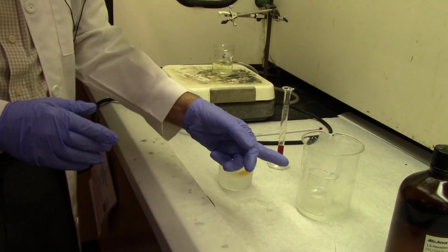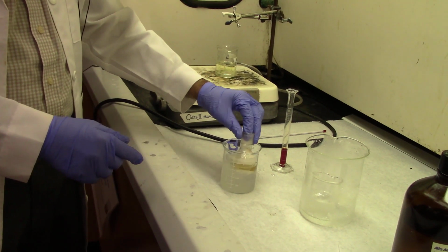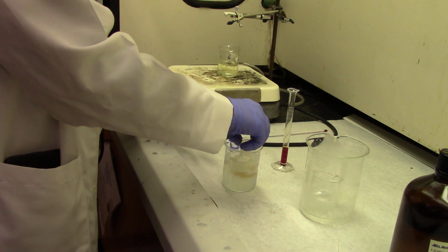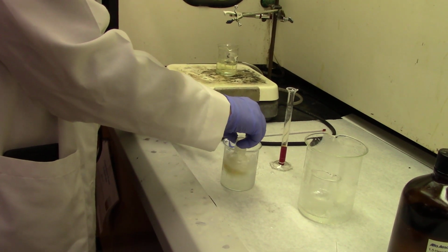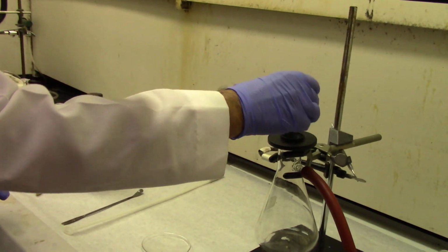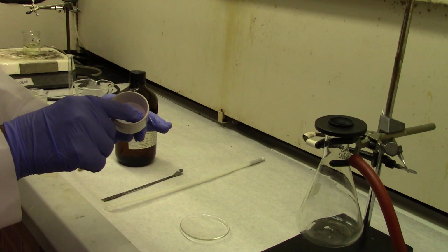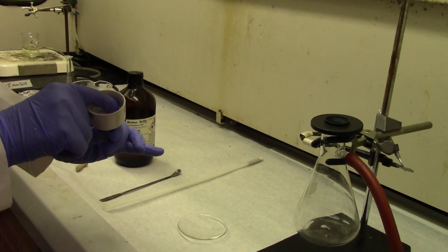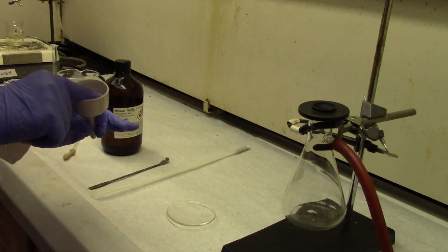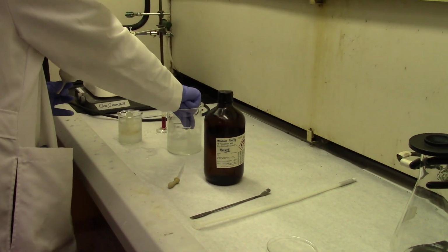The small beaker contains dichloromethane, and we are basically cooling that, because we need this solvent later on for washing our precipitate, or the product. The best way to cool it is to swirl it for several minutes, or just leave it there. And we now have a filter disc in the Buchner funnel. Make sure it covers all the holes. You press it, just press, to make sure it covers all the holes properly.